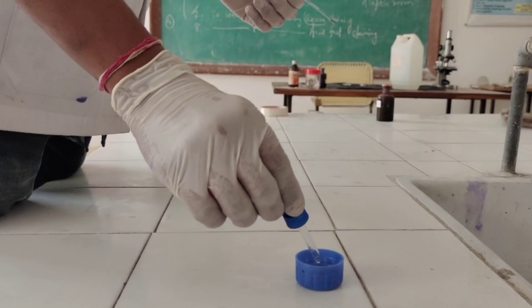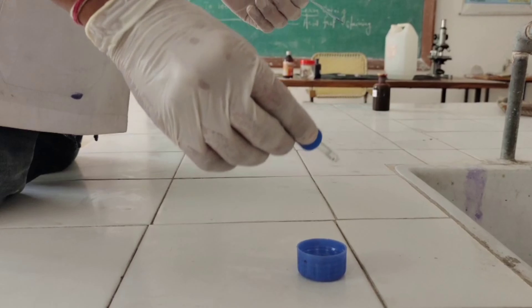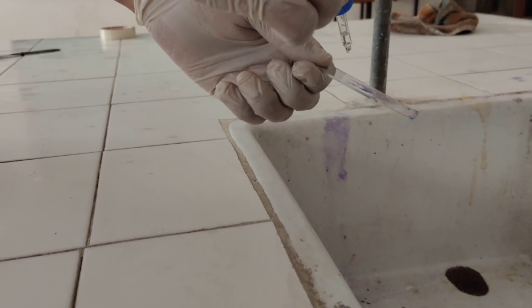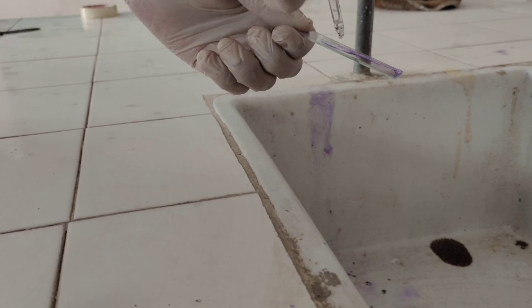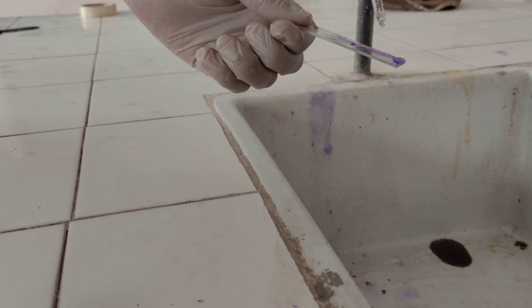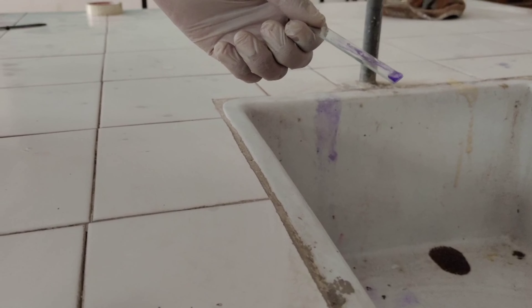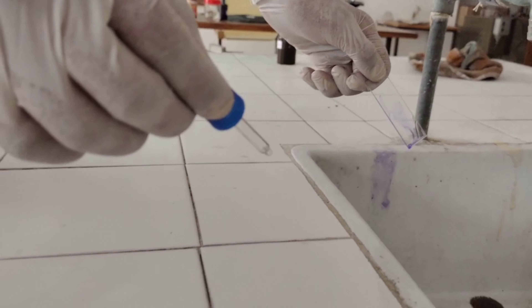The smear was decolorized by 95% alcohol. After addition of alcohol, we will wash the slide again with water.